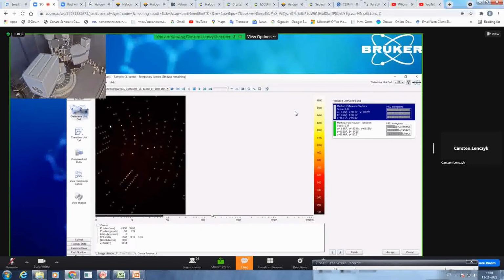And you see here that you have a nice fitting unit cell found. So what does it tell you? This is the real space. This is the reciprocal space. And with a deviation of 0.1, it could already assign 95% of all reflections. So it's 422 or 442 reflections it could successfully assign to this unit cell it found. So this is very reasonable. So we accept this solution.